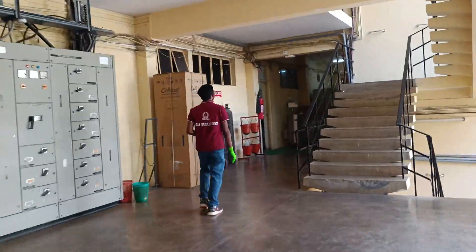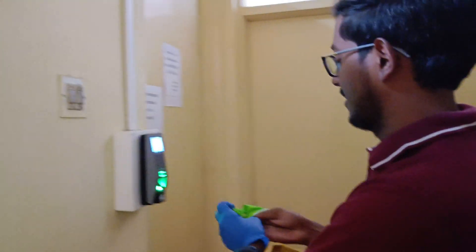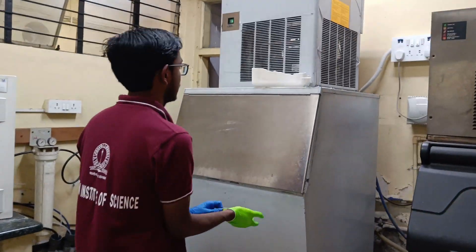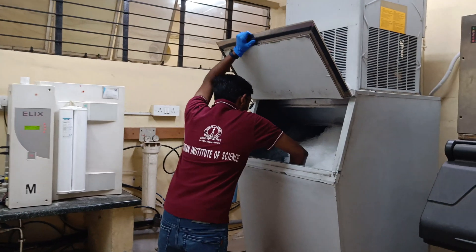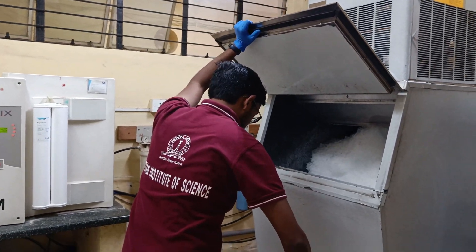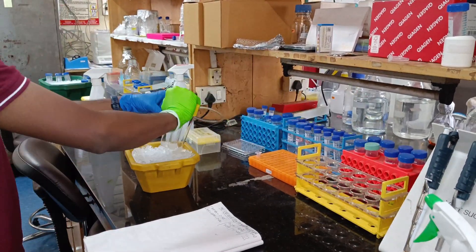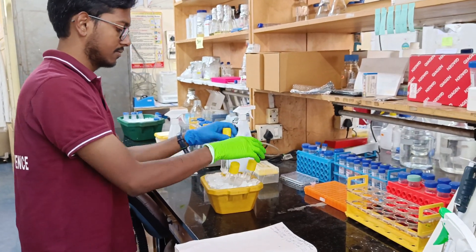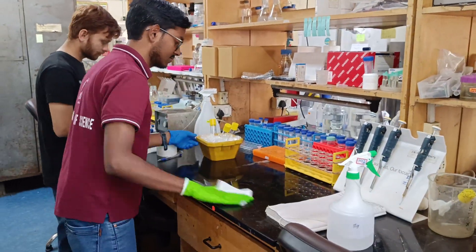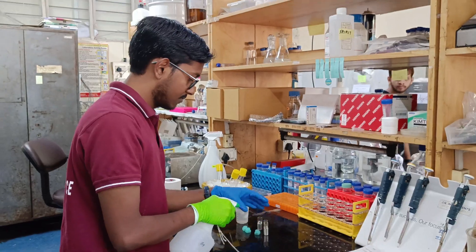For transformation I will use the electroporation method. I am going to transform some plasmid DNA into my Mycobacterium smegmatis cells — a bacteria — through electroporation. As this microorganism has a very thick cell wall, we cannot use the heat shock method for transformation, so we need electrocuvettes. The electric pulse from the cuvette causes the DNA to enter into the cell.